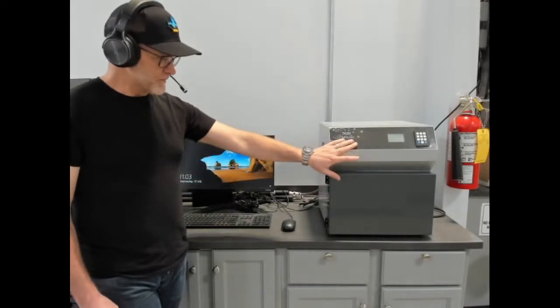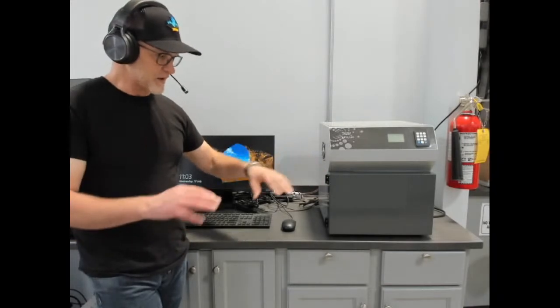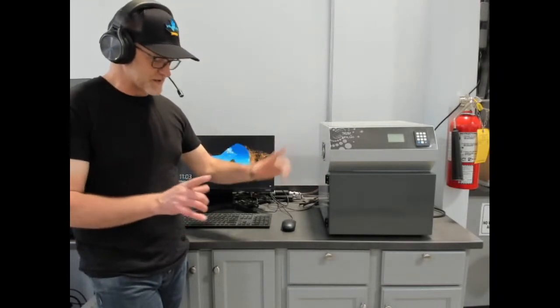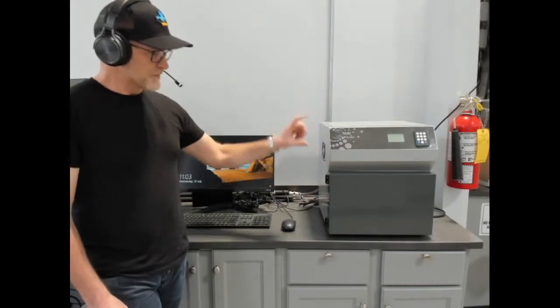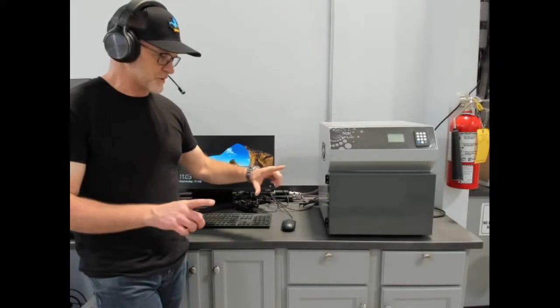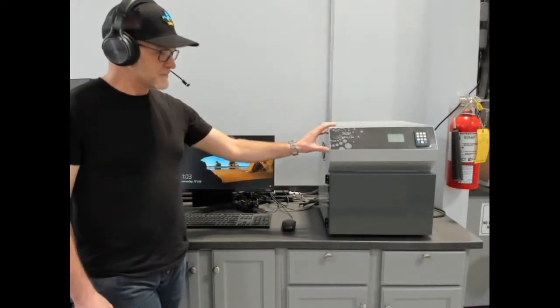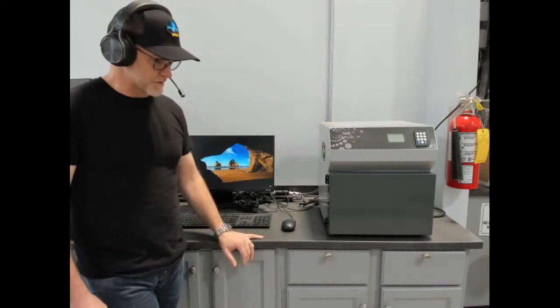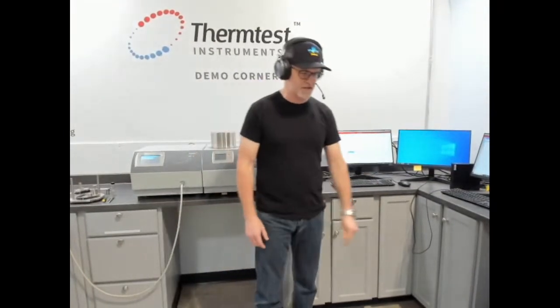There's one other model, and it's called the HFM 50, and that would be everything identical in terms of specifications except for the inside space, it being up to 50 millimeters thick or 2 inches thick and sample size of 8-inch square or 200 millimeter square. And that's designed for insulation and construction materials. So those are our two thermal resistance methods, uniquely important given the industries they serve.